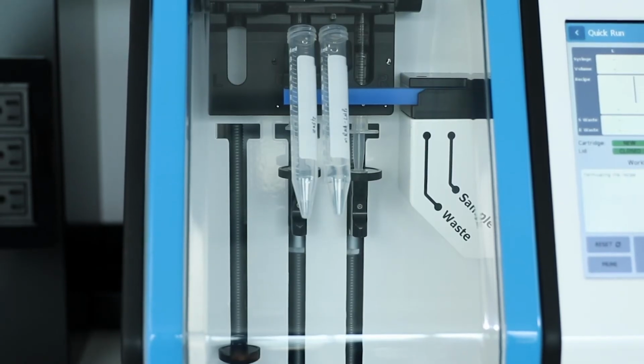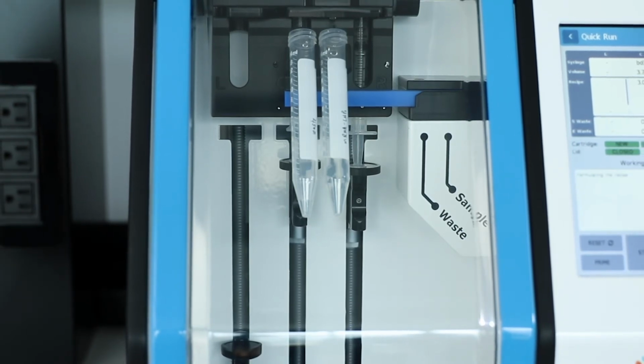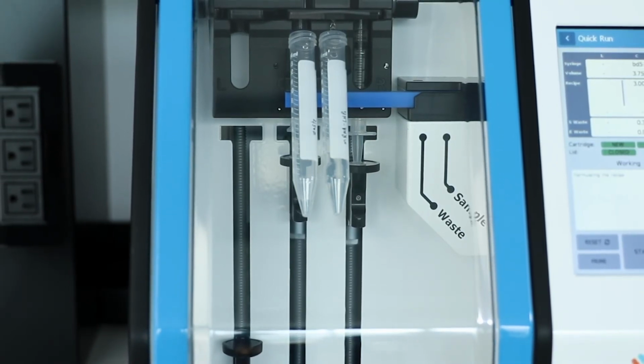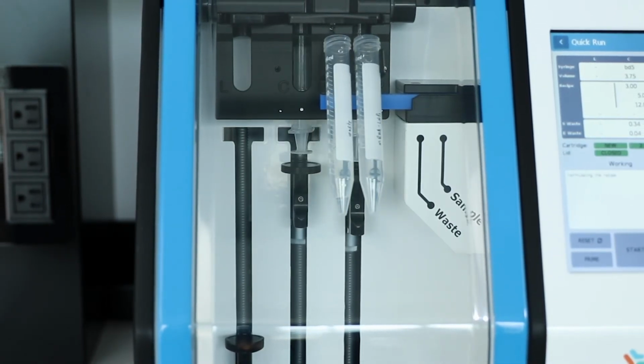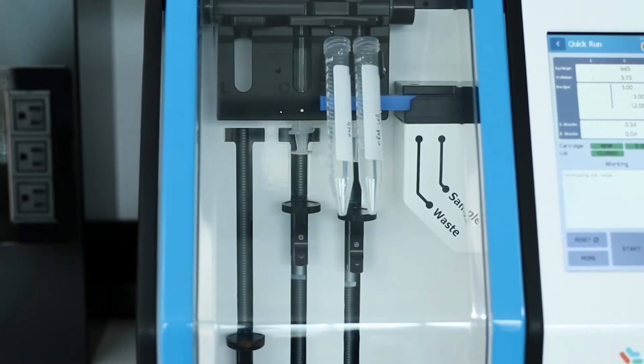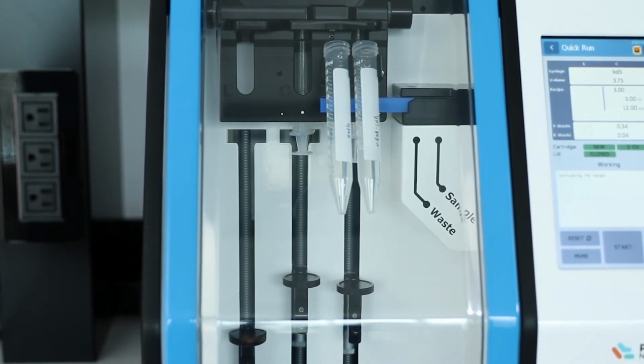And here you have a 5 ml formulation which encapsulates more than enough RNA to meet all the in vivo dosing requirements of the paper. You can make formulations between 1 and 15 ml pre-dilution, which is ideal for exploring the formulation design space and evaluating formulations in a range of in vitro and in vivo models.